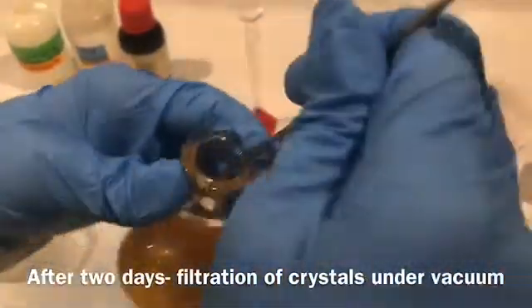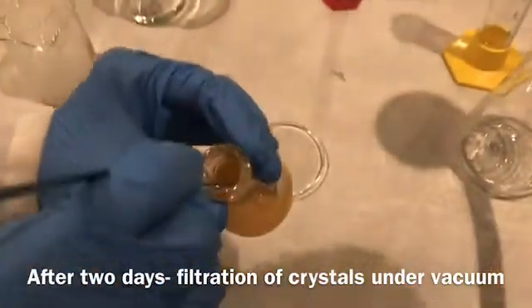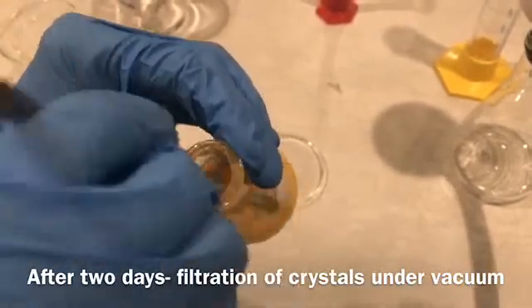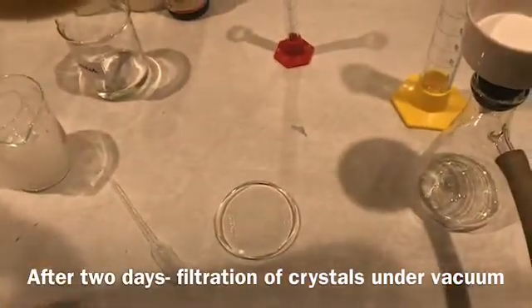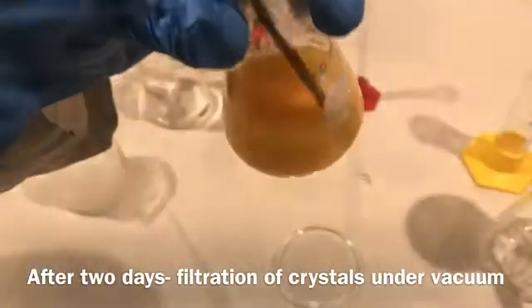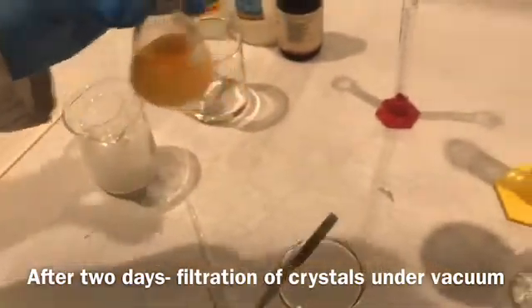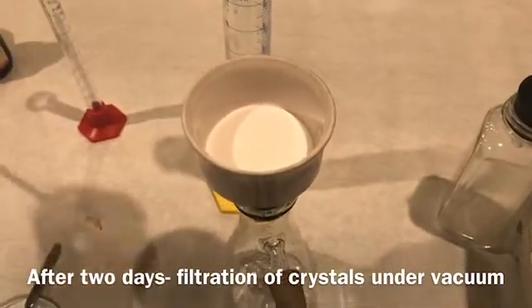Now I am going to break the crystalline mass with the help of a spatula, then I will swirl it and filter it in the Büchner funnel.